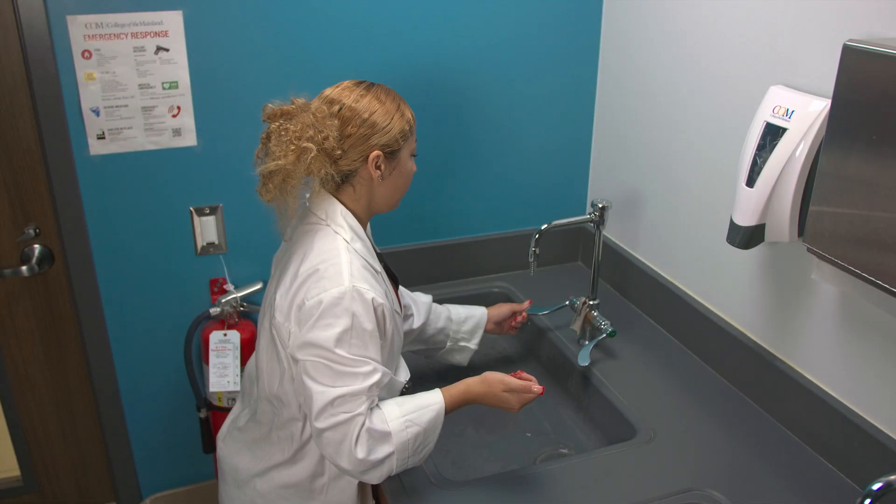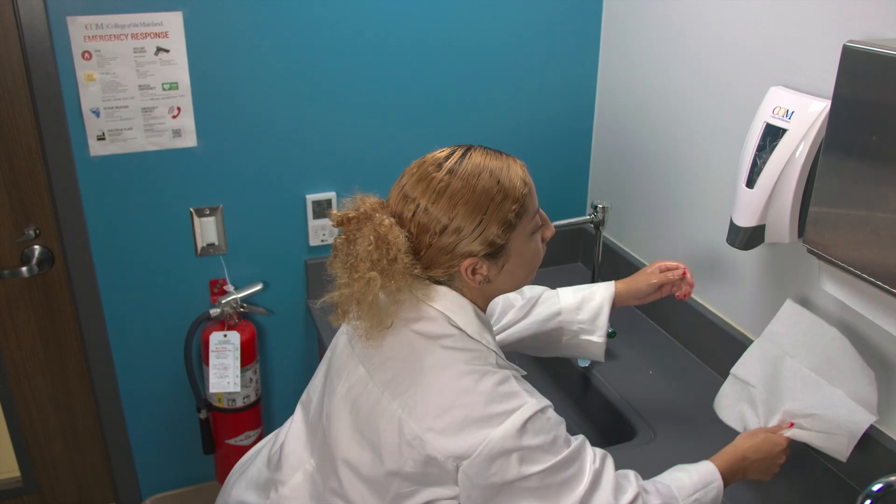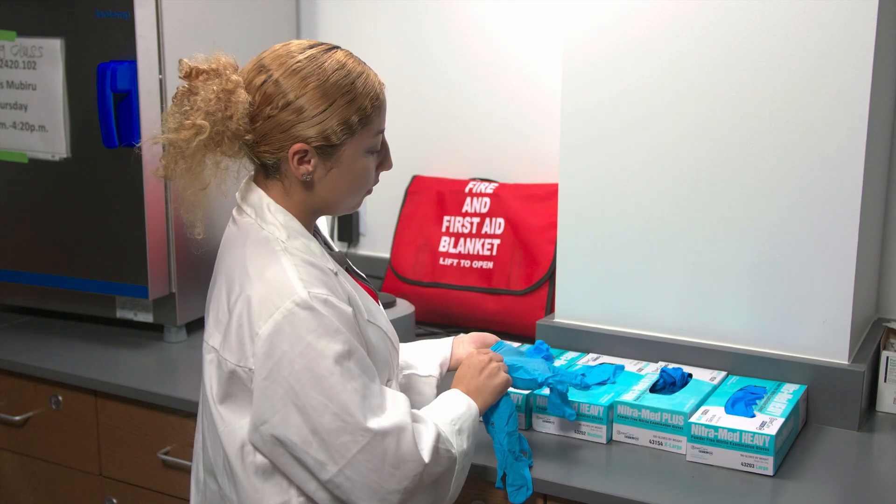Before you get started, wash your hands and dry them thoroughly. Afterwards, put on your lab coat and your gloves.